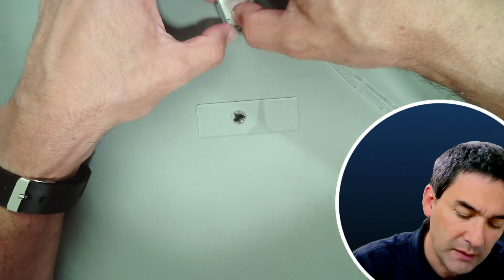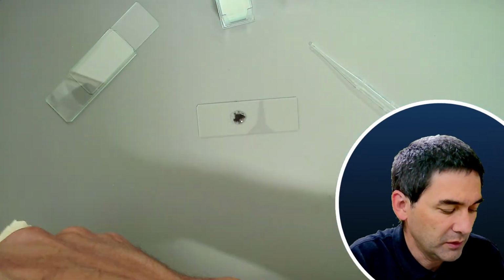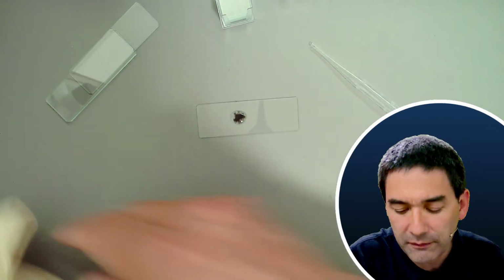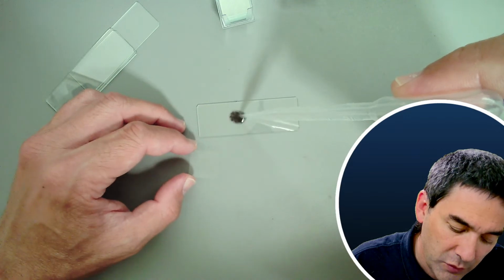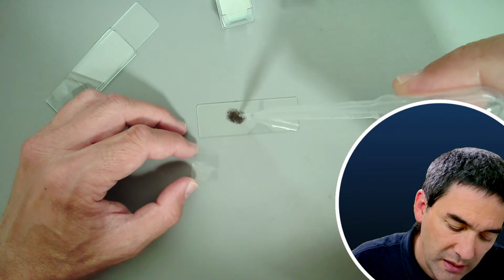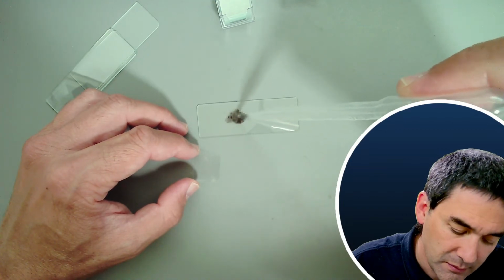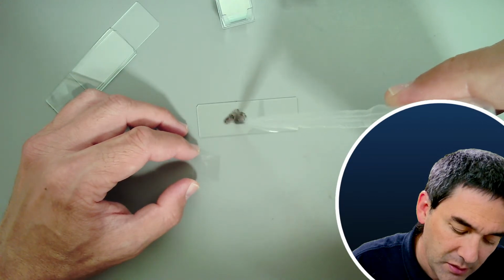You can see that I have already placed a drop with some of the black substance and material on here. What I'm going to do next is break apart the clumps a little bit. I've already tried this today in the morning, and I realized it's much better if you break apart some of the clumps, because this way the cover glass is going to be much flatter on the microscope slide, and it's going to be a little bit easier also to see some of the specimens here.